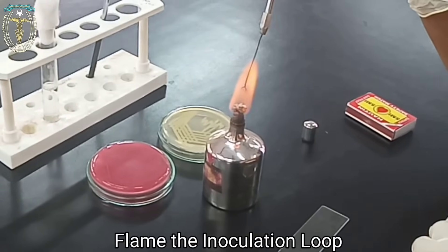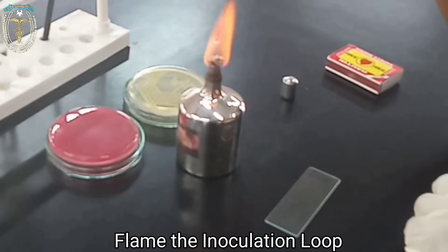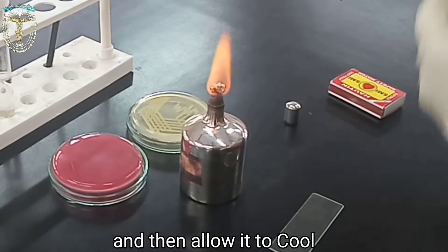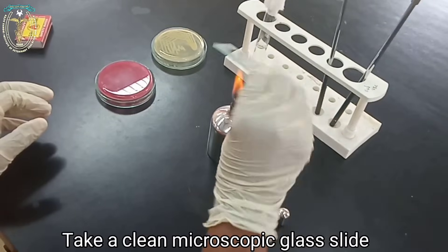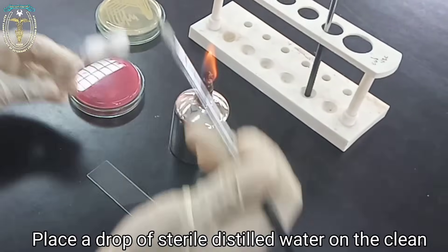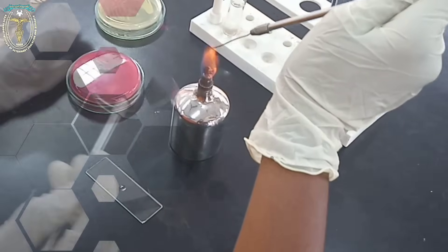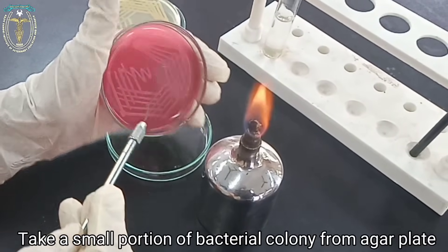Flame the inoculation loop to red heat and then allow it to cool. Take a clean microscopic glass slide and place a drop of sterile distilled water on it. With the help of the inoculation loop, take a small portion of the bacterial colony from the bacterial culture plate.